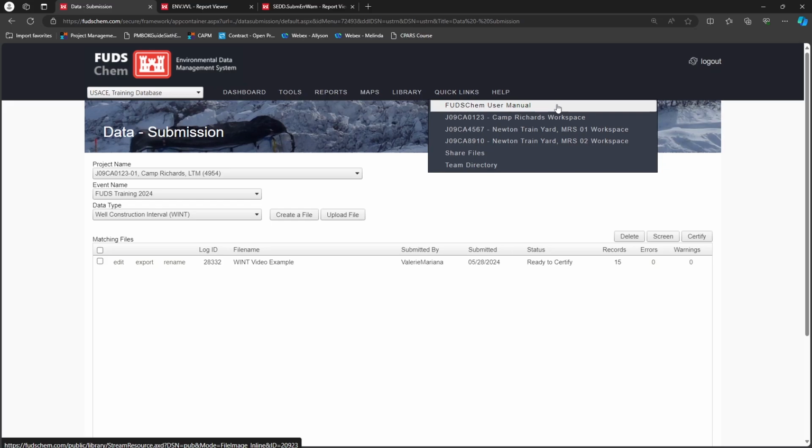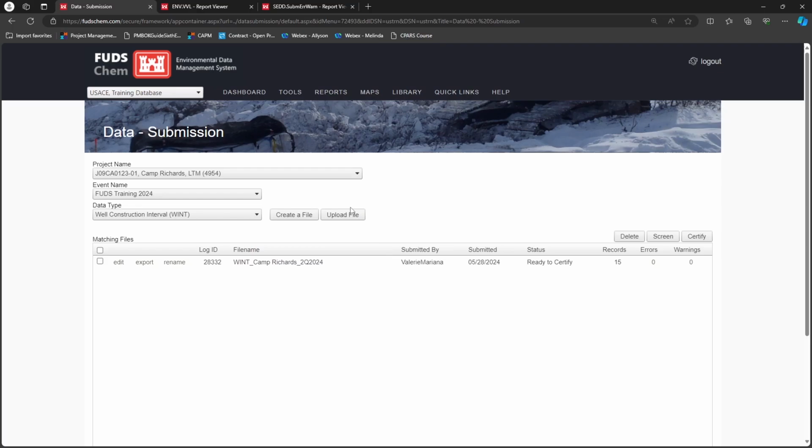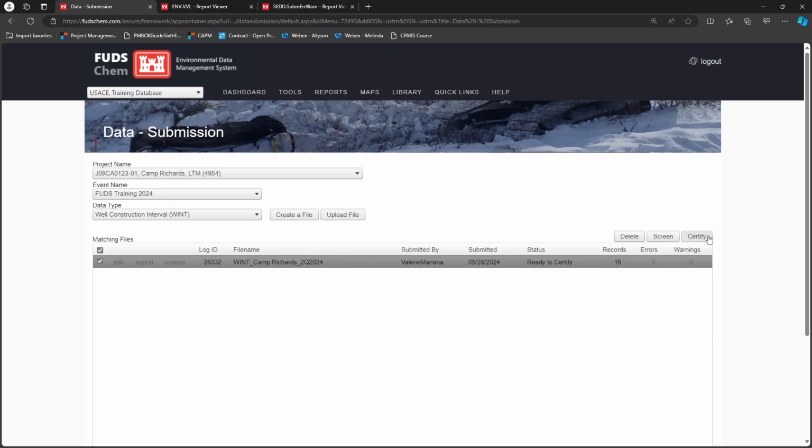Following the naming convention, we will name our file wint_camprichards_2q 2024. Finally, select the file and click Certify. This sends the file into the queue for review.